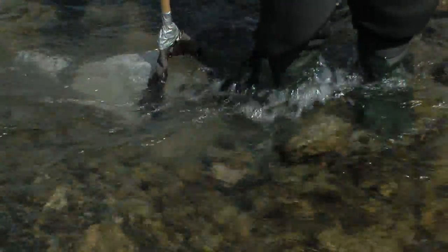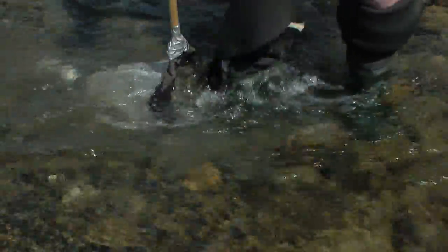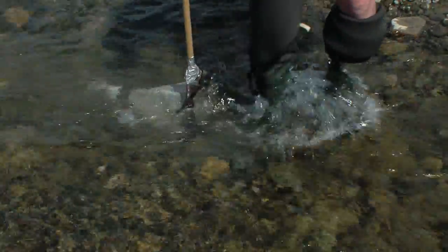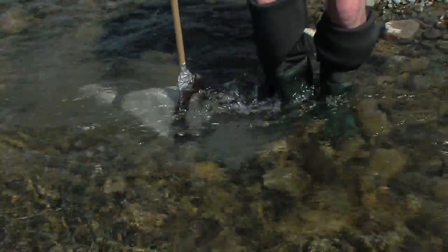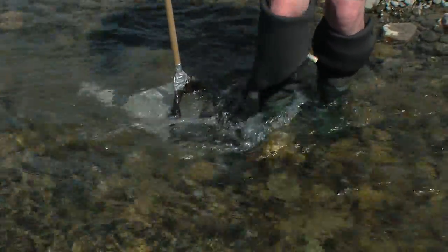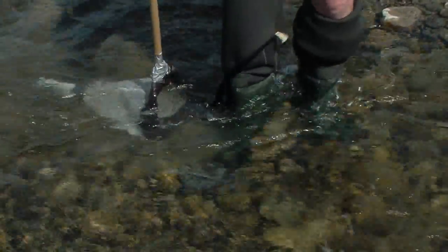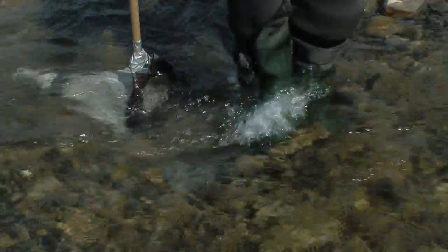You can see here I'm using my boots, kicking pretty vigorously, just kicking in an area almost directly in front of the net.